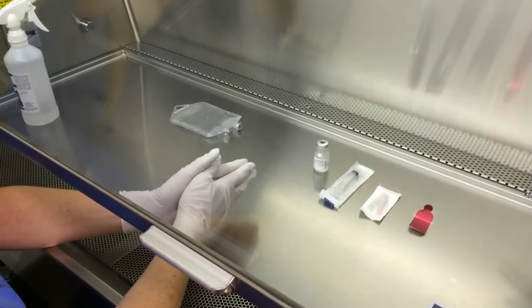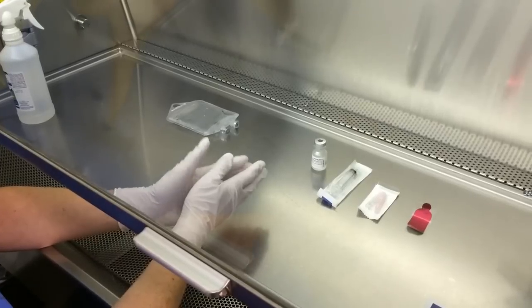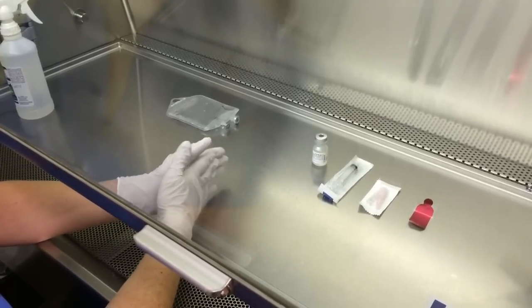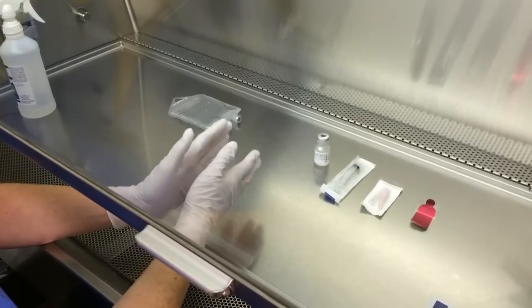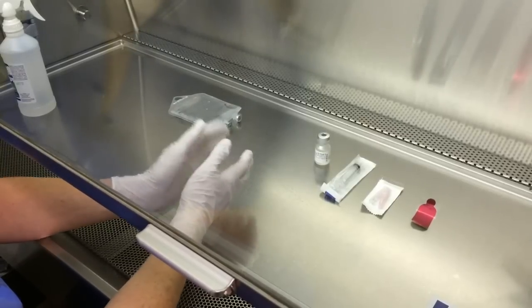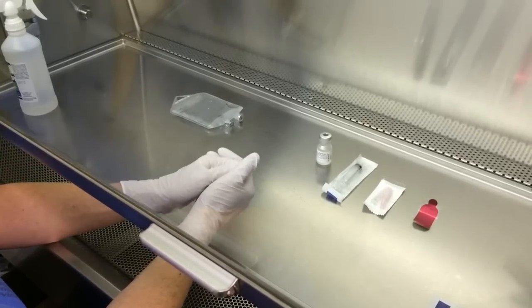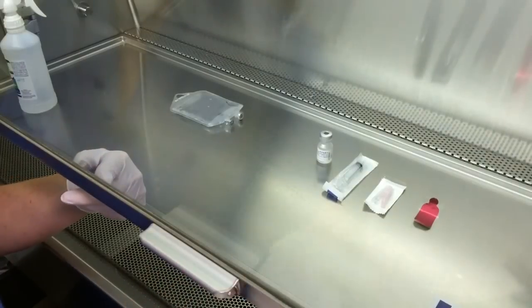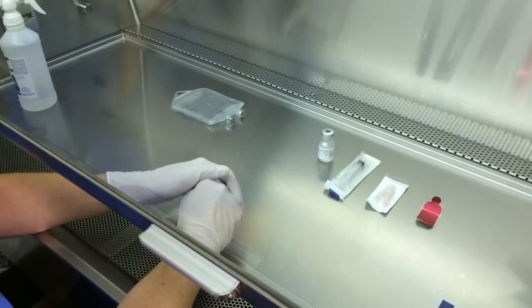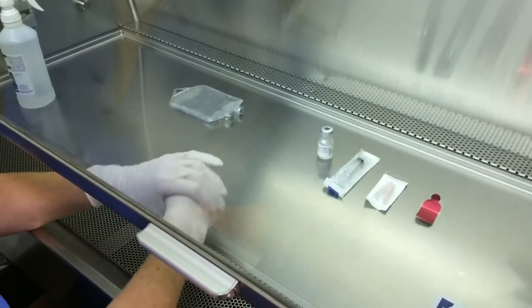Today I'm going to demonstrate how to put a medication into an IV bag using the vertical flow hood. You want to make sure that your screen is open no more than eight inches so that you don't have too much air coming into your hood.